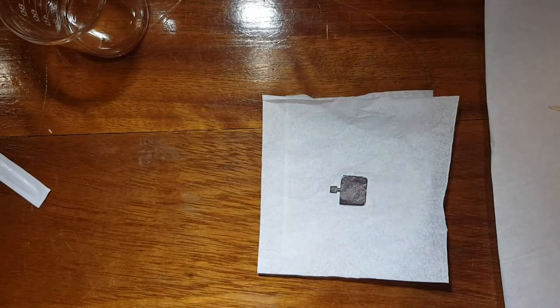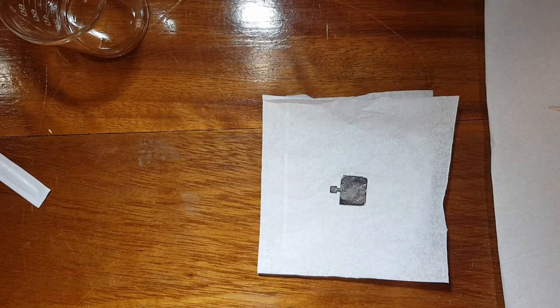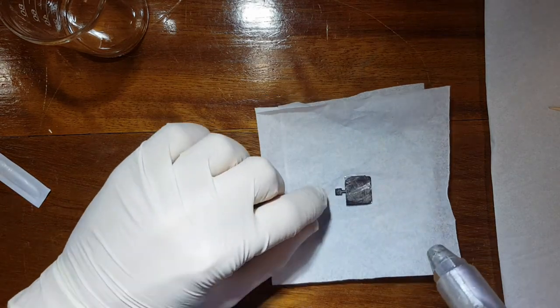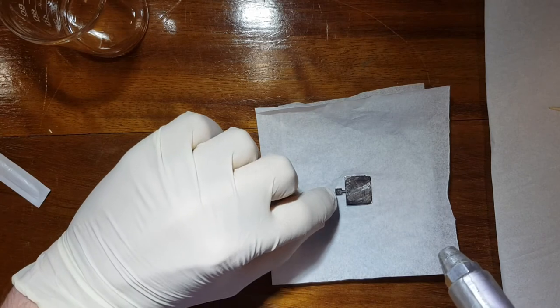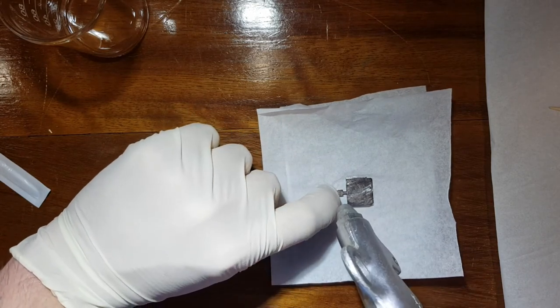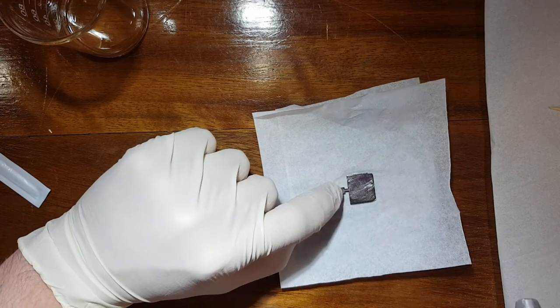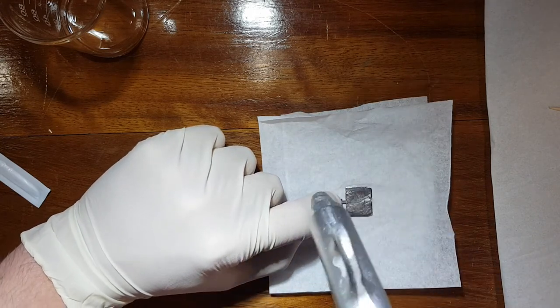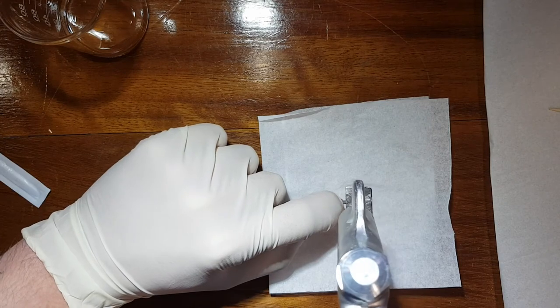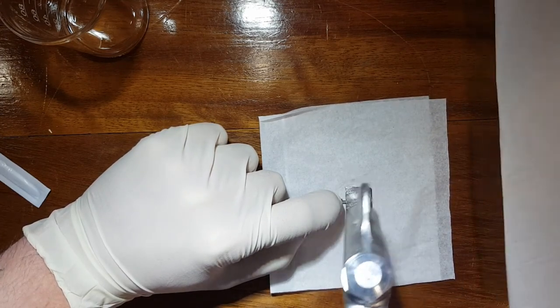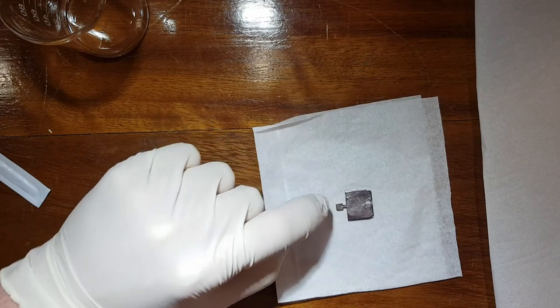So what we do is we take a bit of compressed air. We take some compressed air. I like to, with clean gloves, like to just apply gentle pressure on the back tab to eliminate the amount of surface area I cover with my fingers, and I just blow some air directly down, not full force, just a little bit. Although that might be very annoying to hear, that would be enough to dry it off completely.